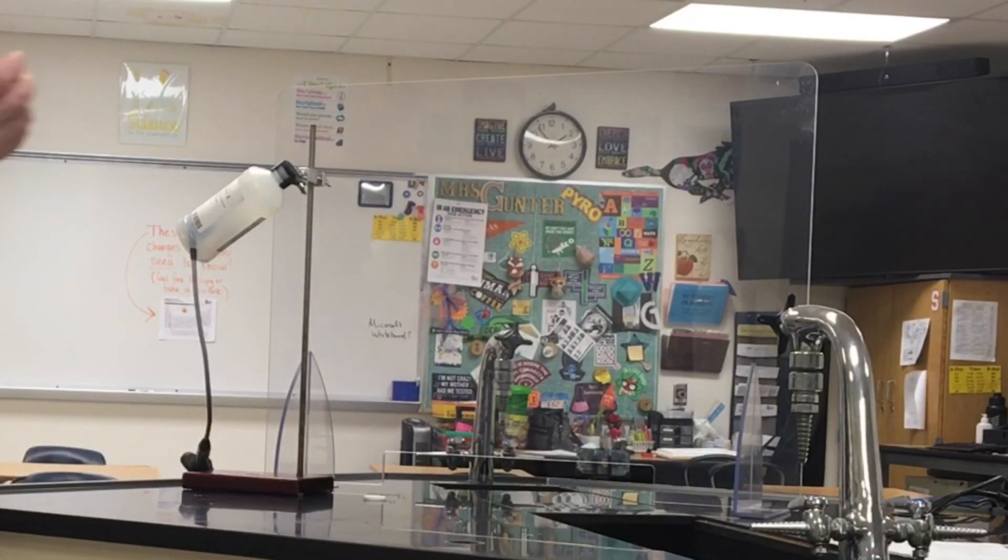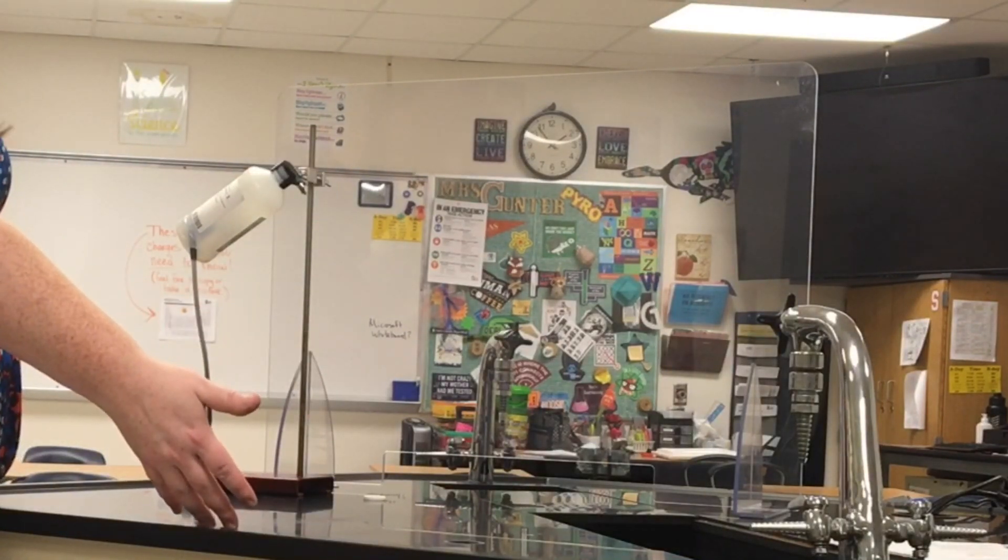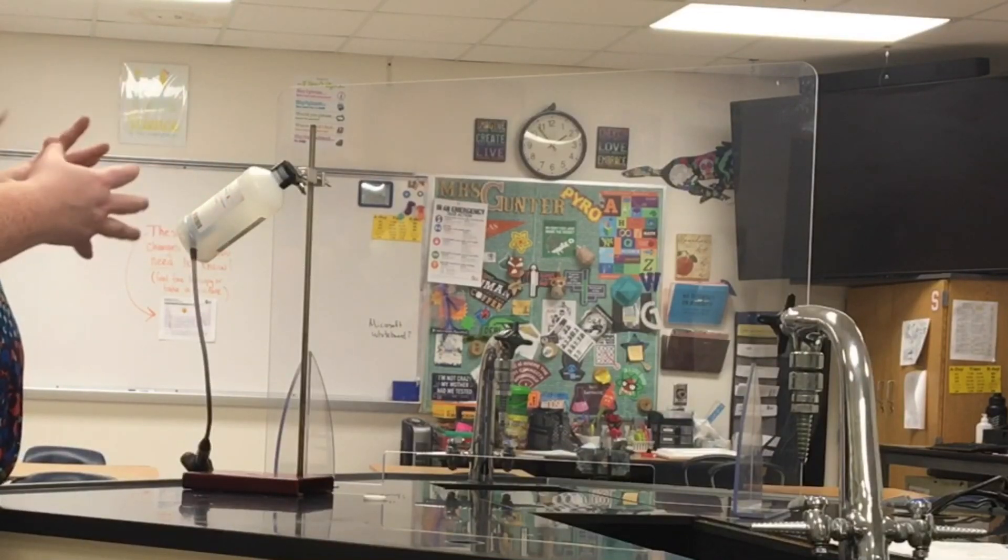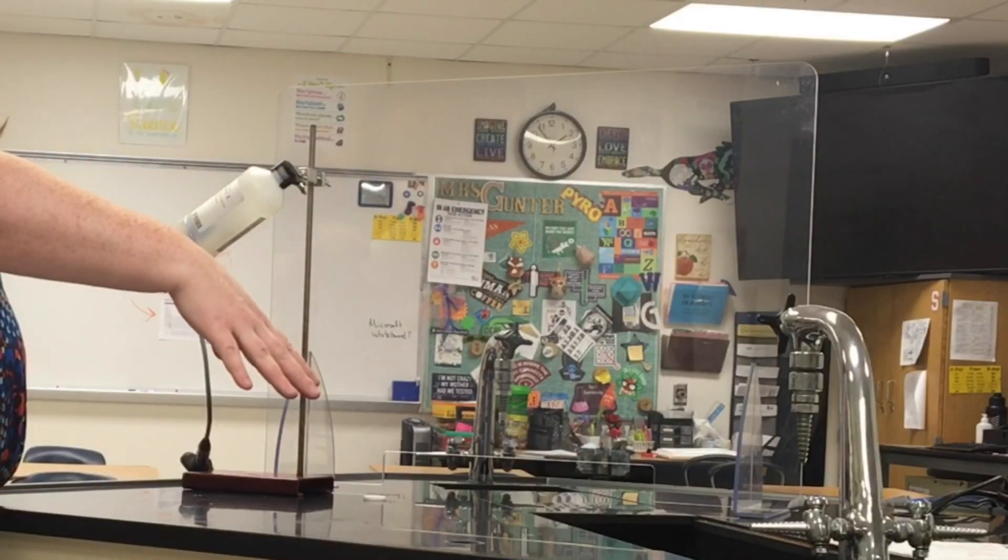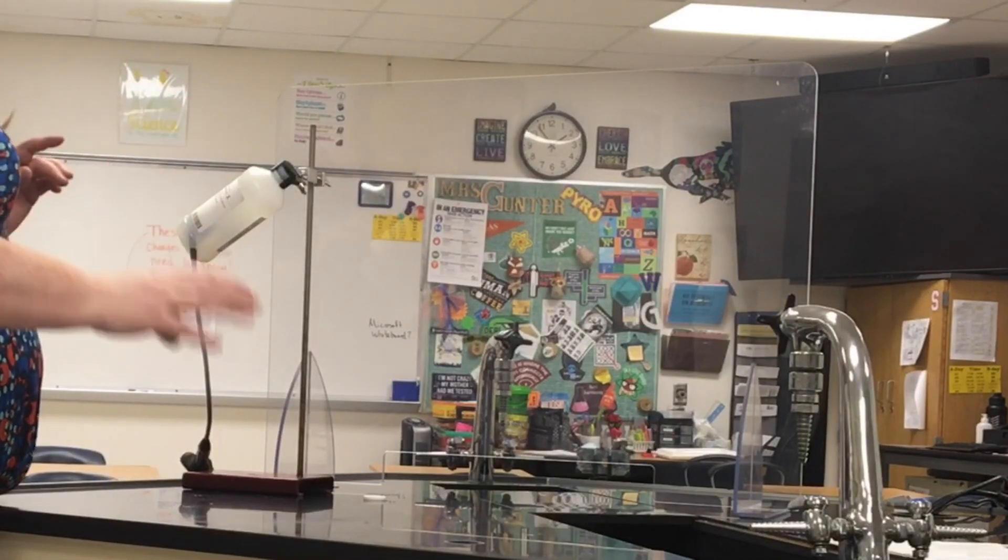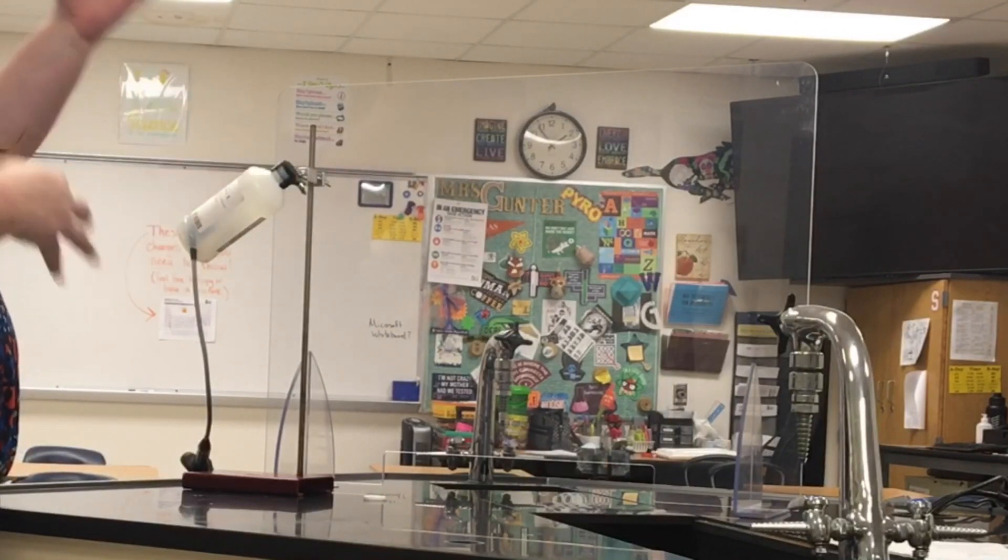What I've actually done already is pour a little bit of that same ethyl alcohol that I had on the desk into this bottle, and I shook the bottle up, poured the extra out. Now I have the gas form of our alcohol still in the bottle with a little bit of that oxygen from the air, so it's ready to ignite again.